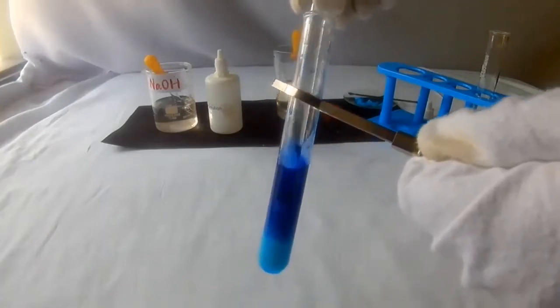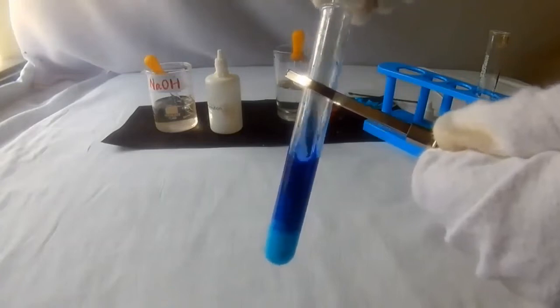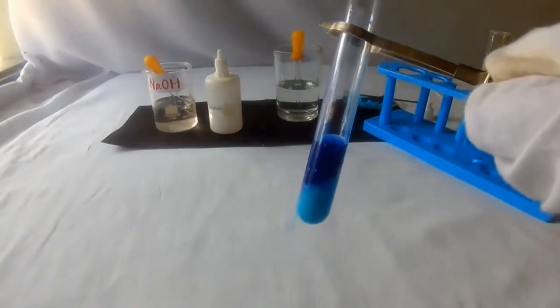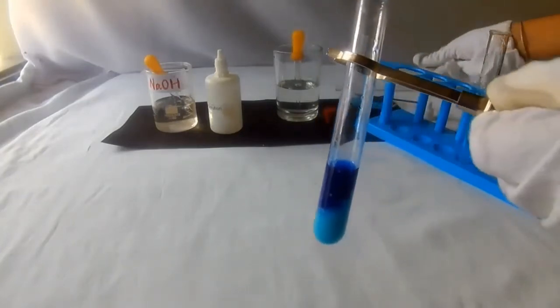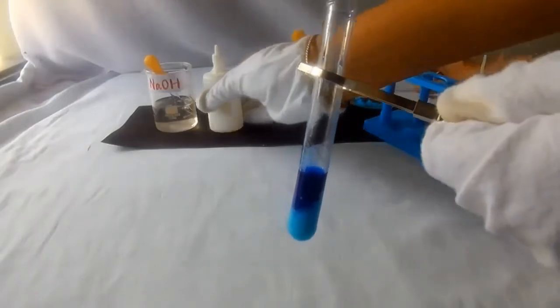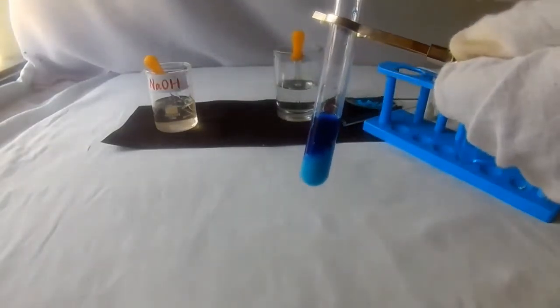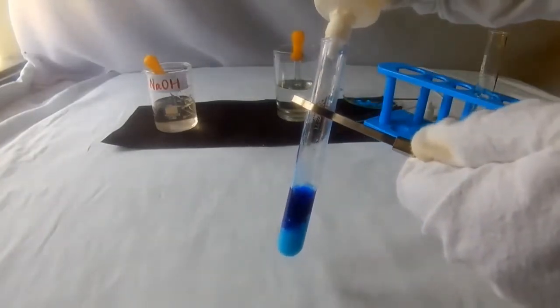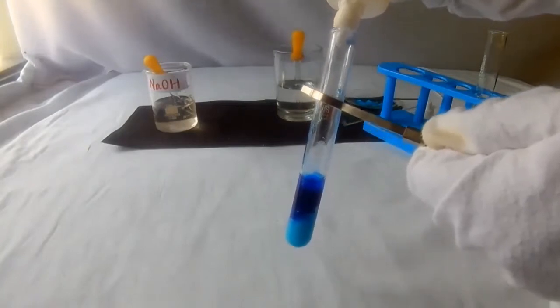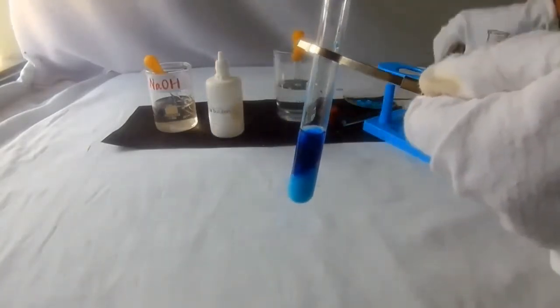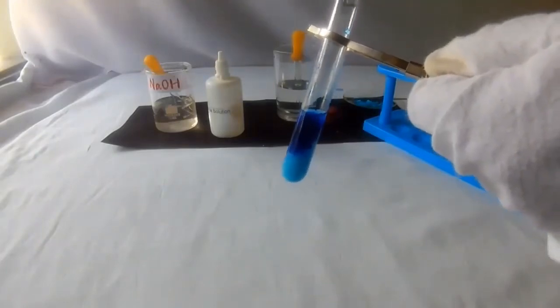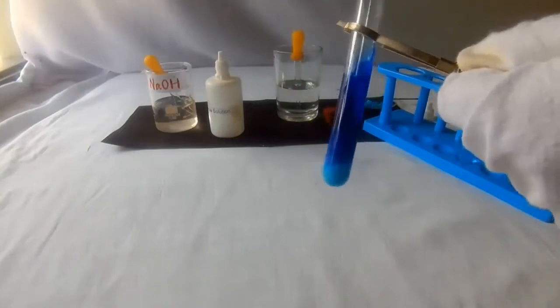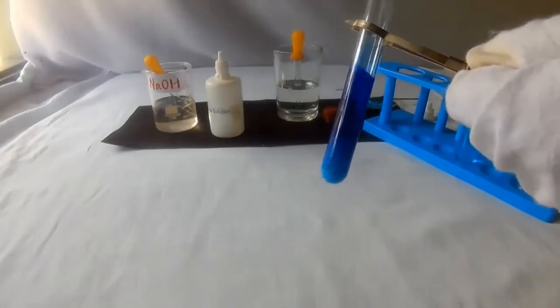Now you can see the pale blue precipitate at the bottom. Stir well. Add some more ammonium hydroxide solution. Stir well. It dissolves to form a dark blue solution.